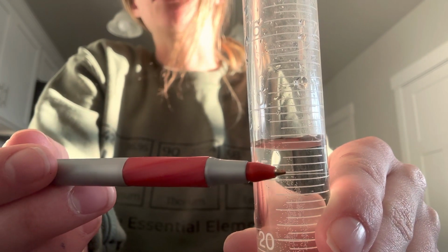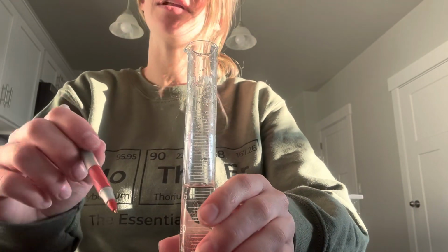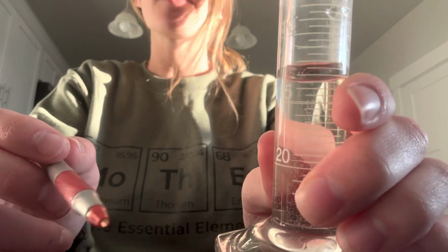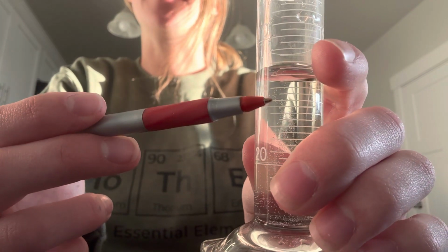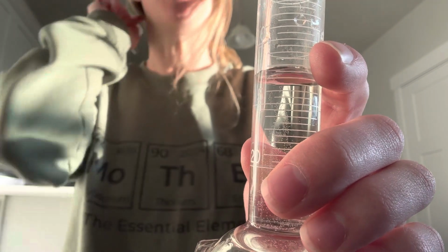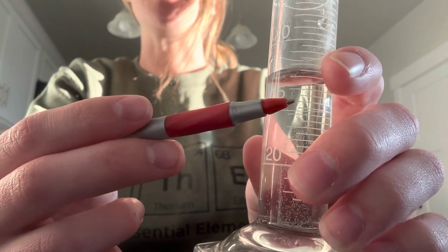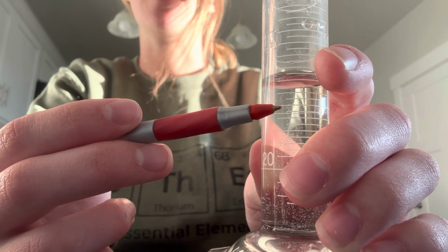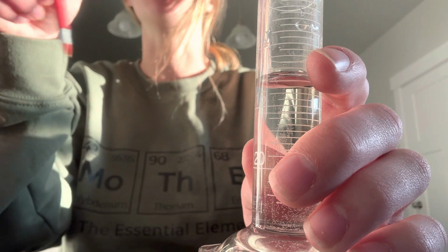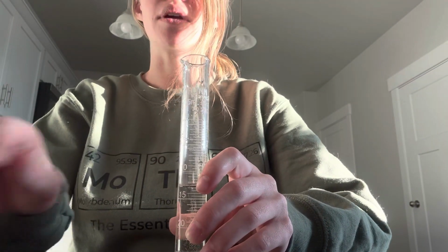Now you can do, if you want, if it's like in between two things, that would be like 0.25 or 0.75, depending on what it is. So if, say, the water was in between the 15 and this half mark, that would be 15.25 because it's in between 15 and 15 and a half. Say it was in between the 15 and a half and the 16 line, then it would be 15.75. So you could do some partial markings as well.